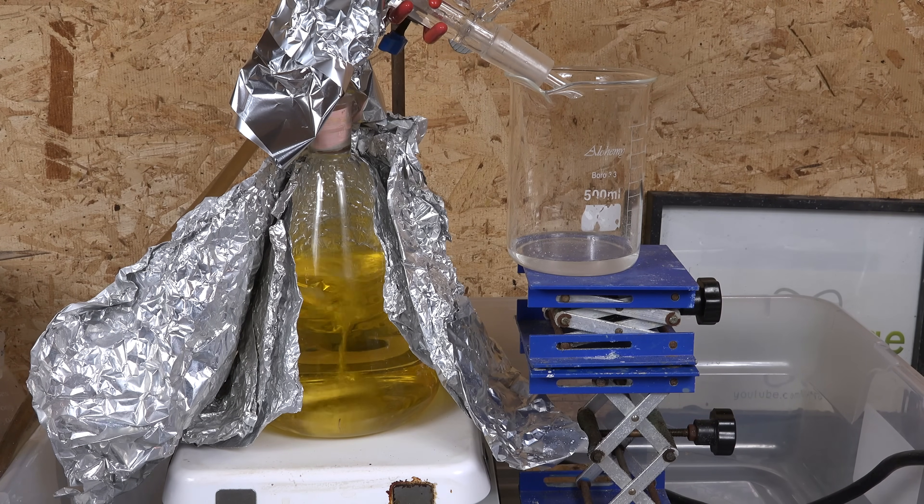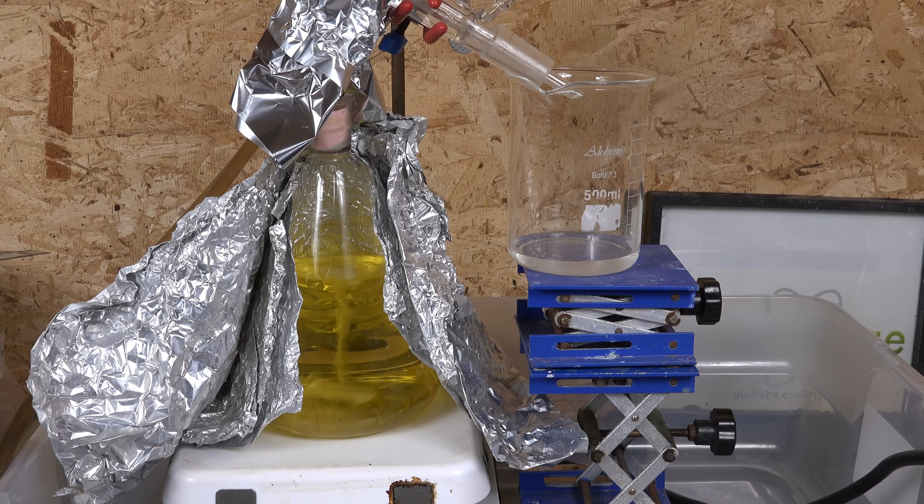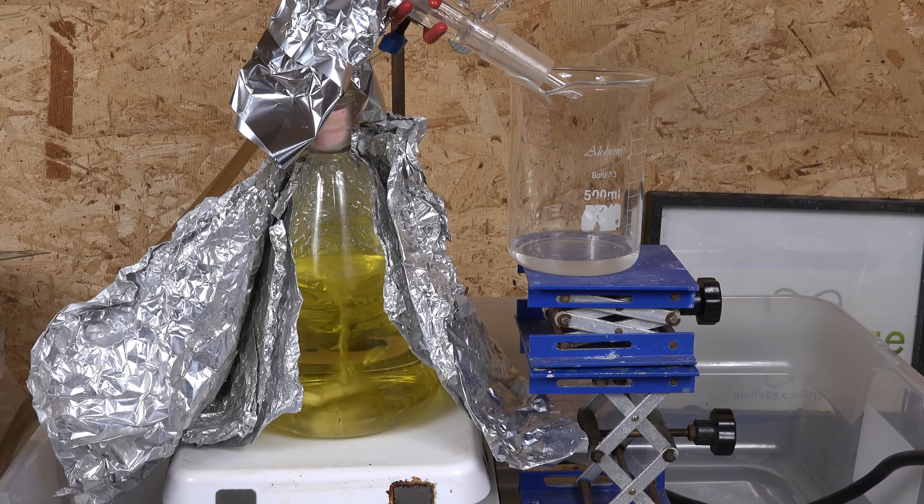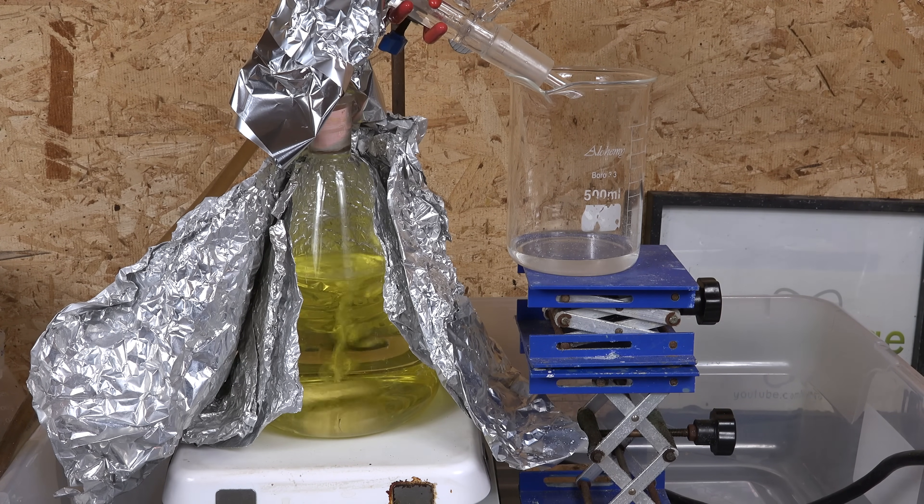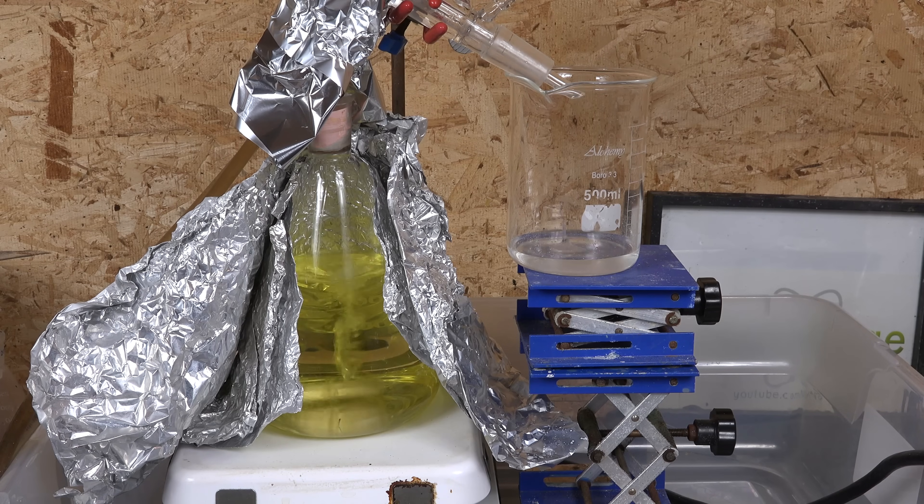This tends to happen as the impurities that were charring and darkening earlier are now essentially burning away as the temperature rises. This is actually the basis for an analytical chemistry technique called sulfuric acid digestion. But we'll cover that in an upcoming video.